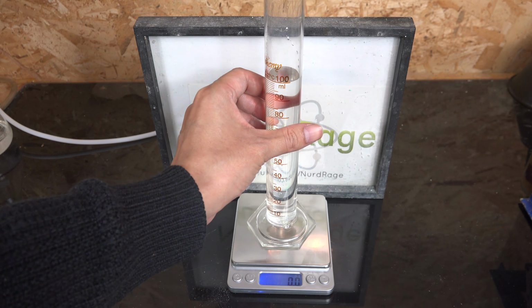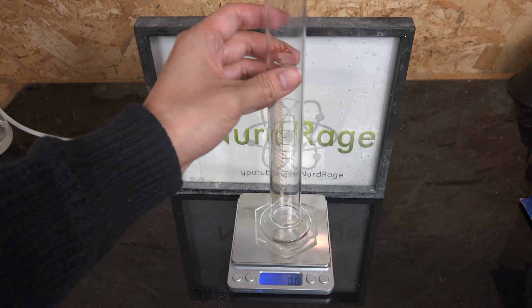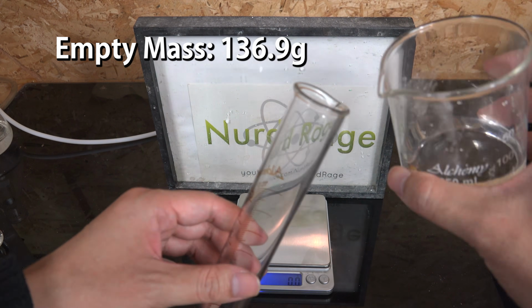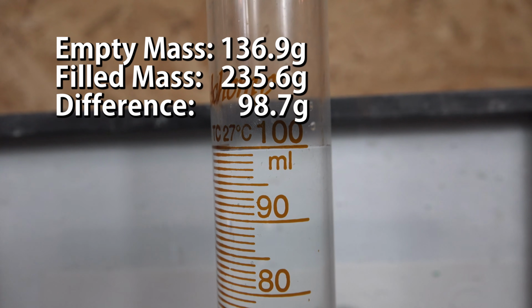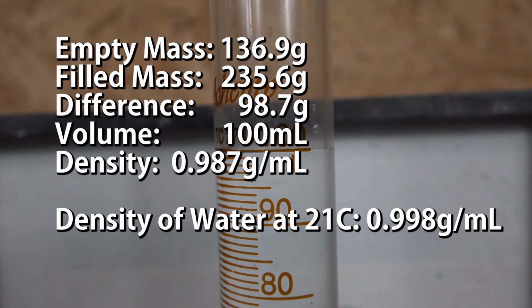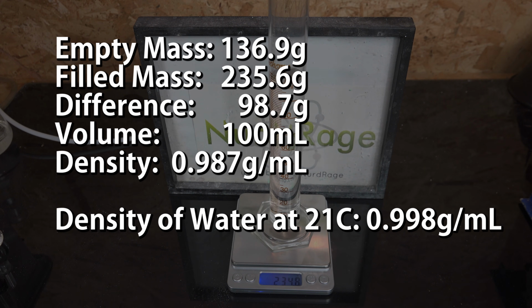The easiest and most straightforward way to measure density of a liquid is using a graduated cylinder. First, we weigh the empty cylinder to get its mass and then add our liquid. We then weigh again and take the difference, which gives us the mass of just the liquid. And then divide by the volume, which we can conveniently read directly off the cylinder. And that's the calculated density. I used deionized water, so the density should be near 0.998 at this temperature. As we can see, we're a whole percent off.